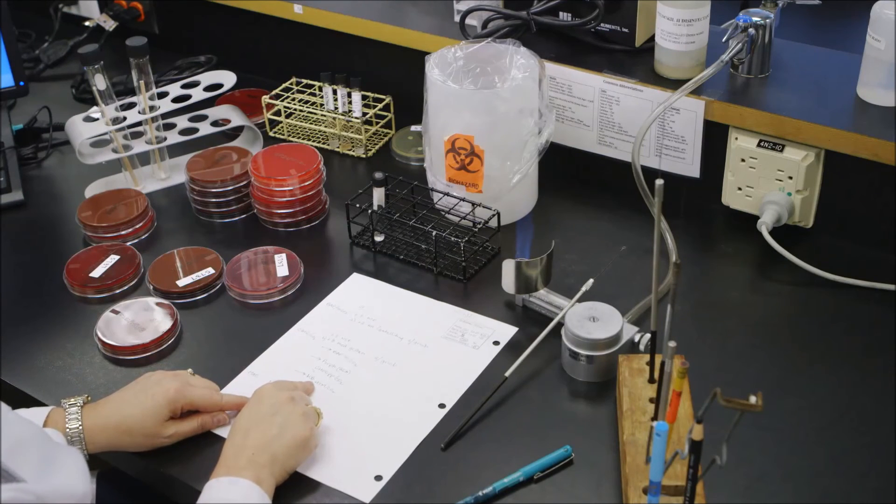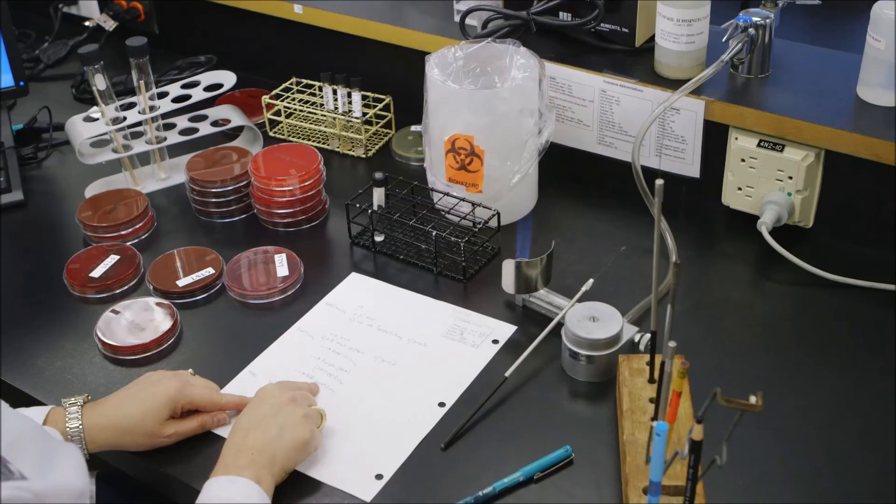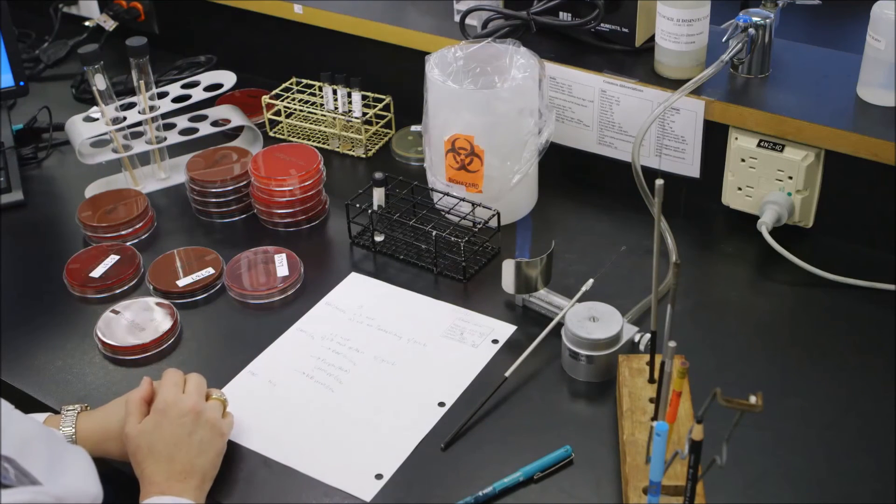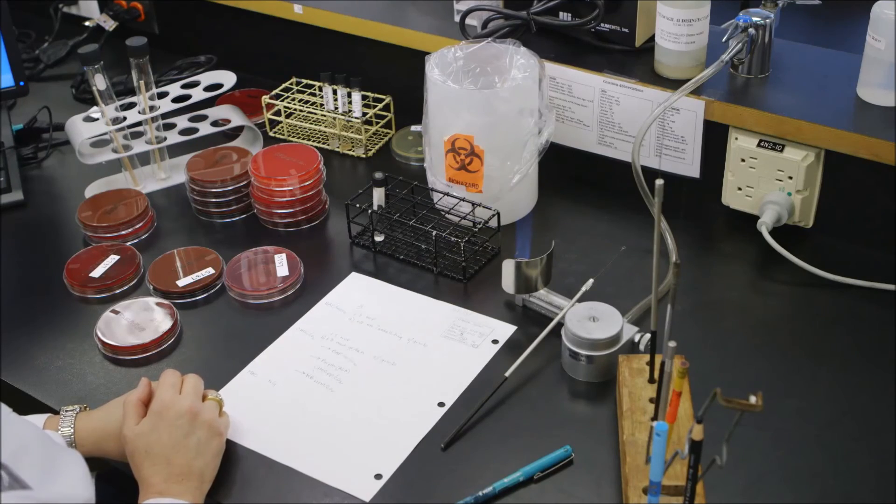The last test we would do is the Kirby Bauer. It's done on an HTM plate and put into CO2. And for purposes of this demonstration, I'm not going to show how to set that up.